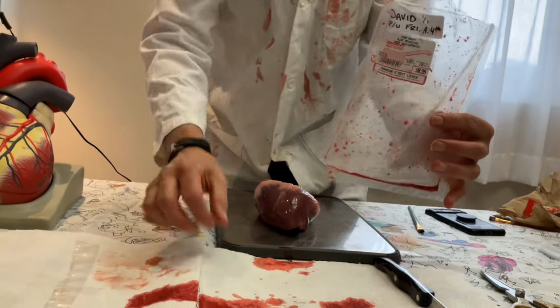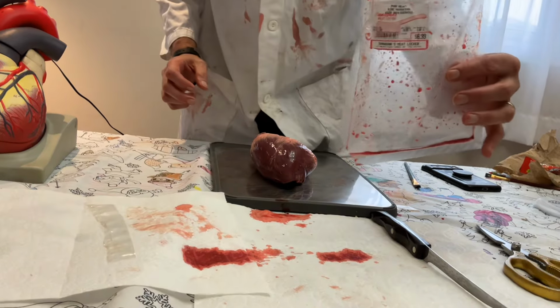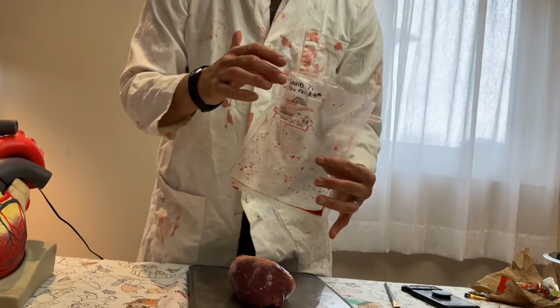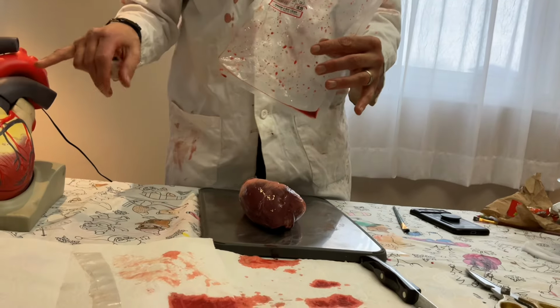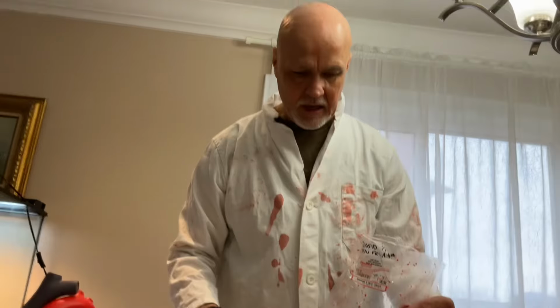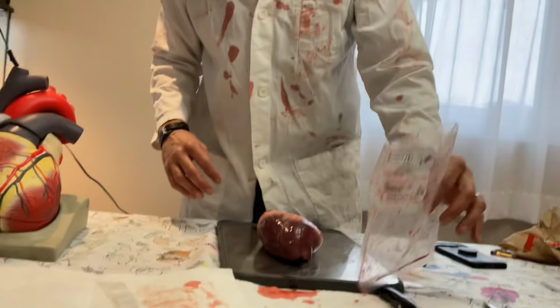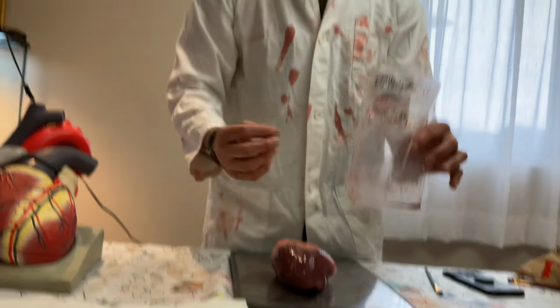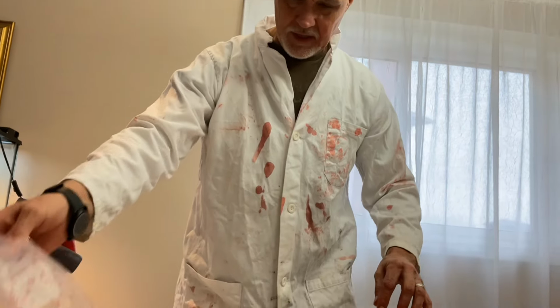And that is not blue at all, is it? It's red. We represent it as blue just because it's easier to distinguish between the colors. And blood that's oxygenated is less brown and more crimson. So that's the difference between these two things.